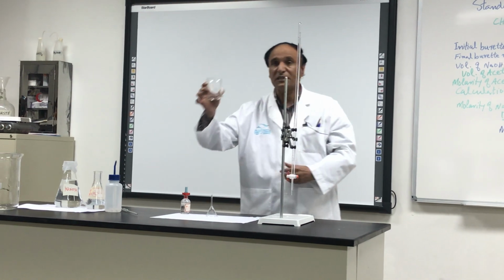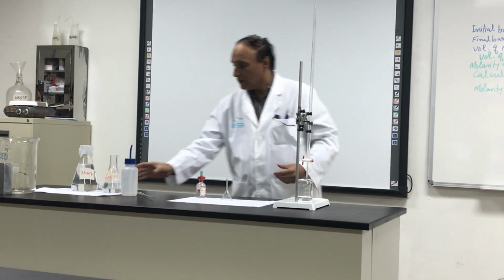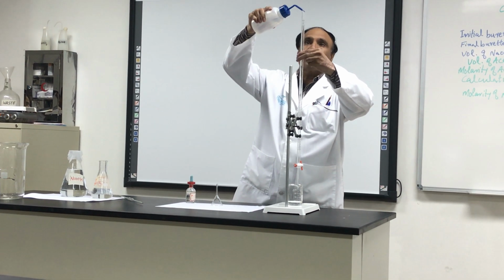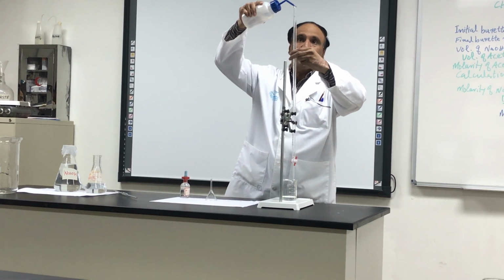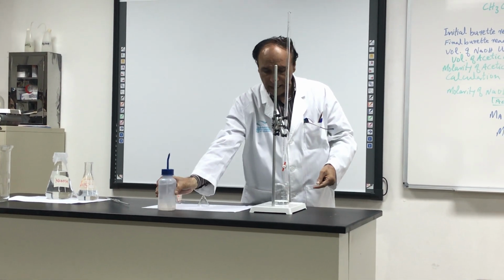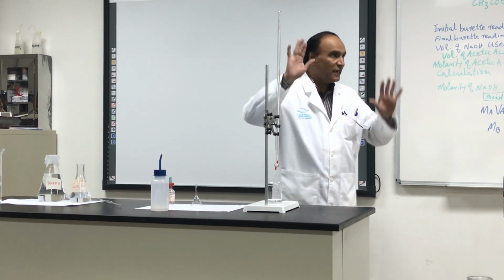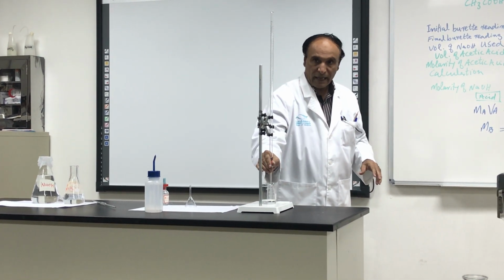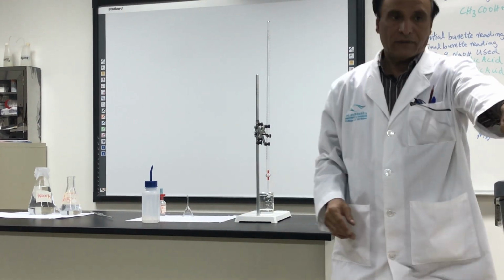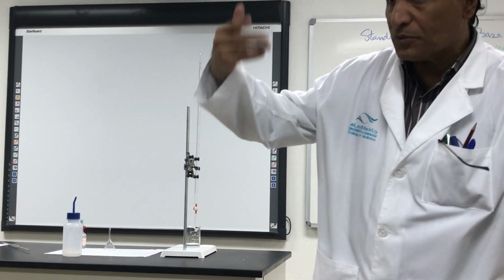So what you do, before you go home, you put some water in that. Look over here. You put some water, and leave it open and do not close it. When it finishes, do not close it. Let everything go like that. Just leave it open, so all the drops should fall down.